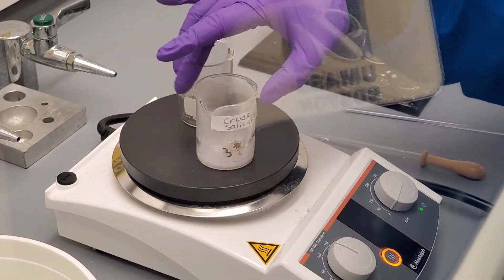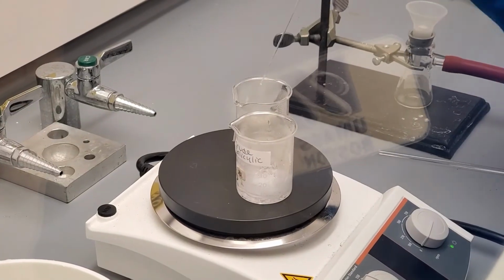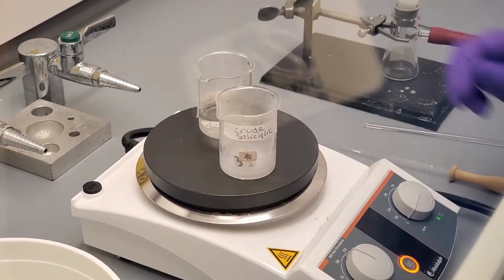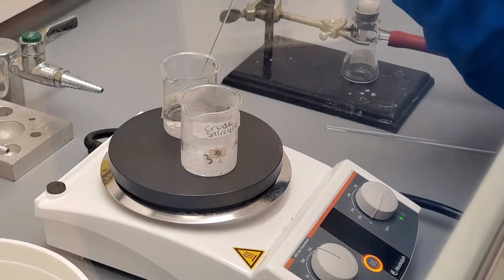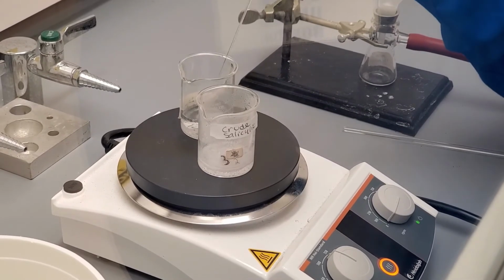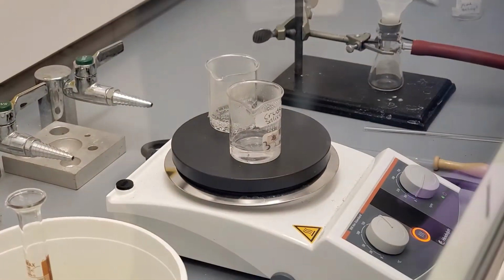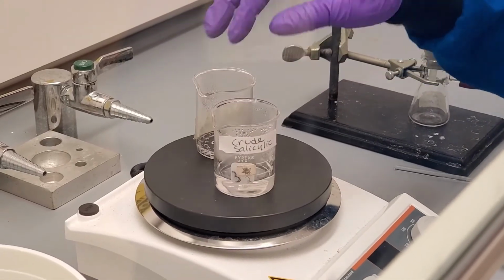This is most definitely not the case since salicylic acid has a low solubility in water. The idea with recrystallization is that the impurities will be more soluble in the water than the product, which is why we need to heat in order to dissolve the salicylic acid. Since we do not know how much water it will take, it is important to add the boiling water very slowly once the salicylic acid starts to dissolve.